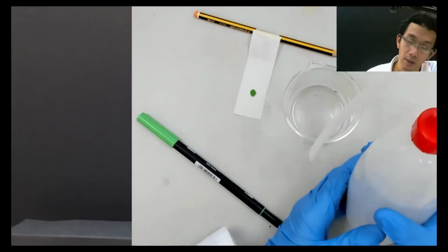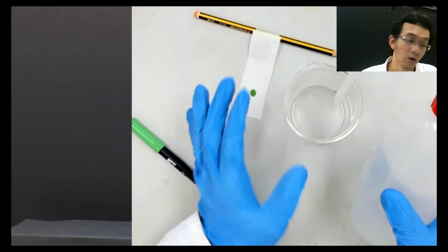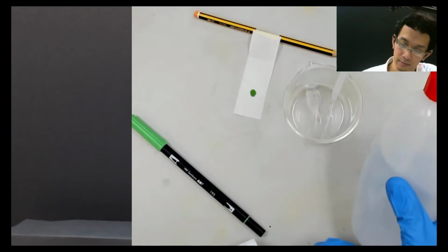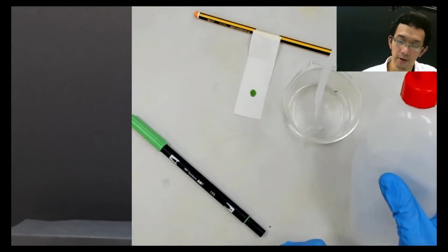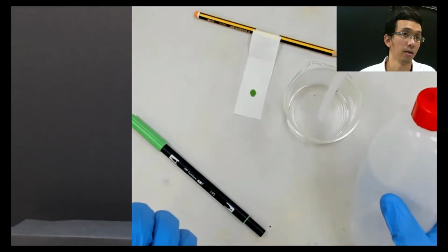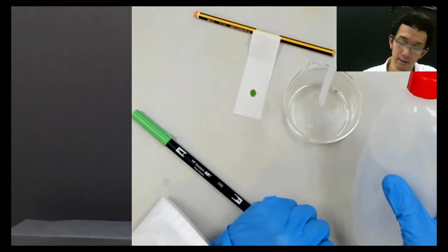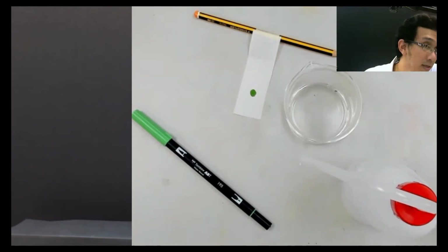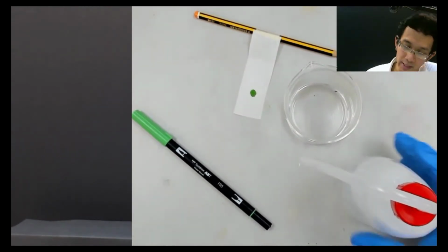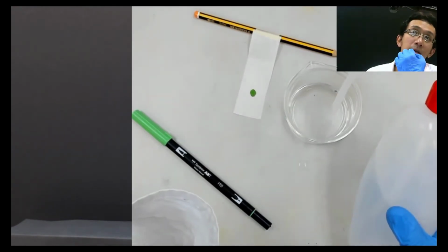Okay, the question now. In chromatography, there is a special name for this water or whatever solvent. What are they called? There is a special jargon for whatever liquid here that I use to kick the solid, the pigment in this. What is the name for that? There is a special term. Yes, name? Mariam. Okay, Mariam, what is the name? Solvent. Solvent, yes, but what is the term for that solvent?